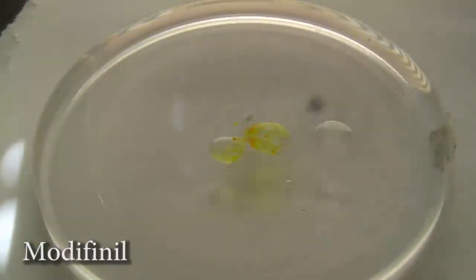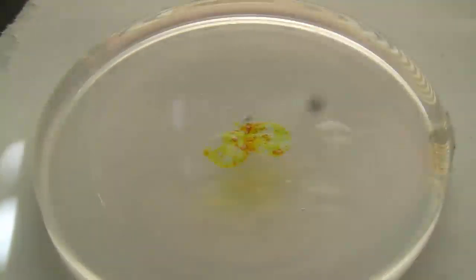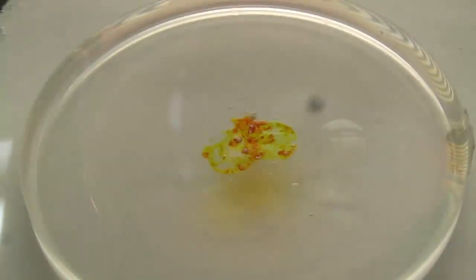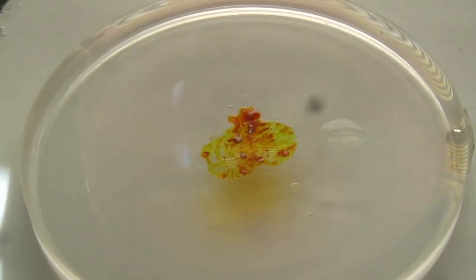This is Modafinil, the so-called smart drug. And, well, you can see it's a pretty quick and pretty bright color change. Yellowish-orange, and this is definitely the brightest color.